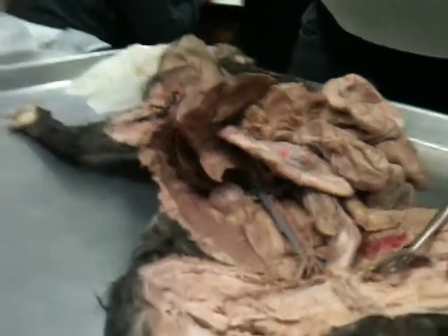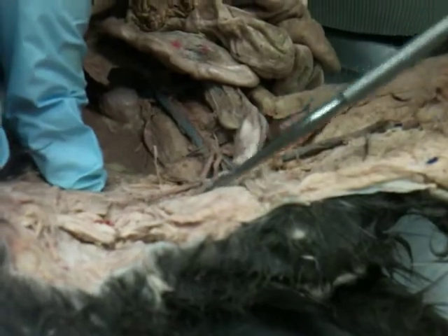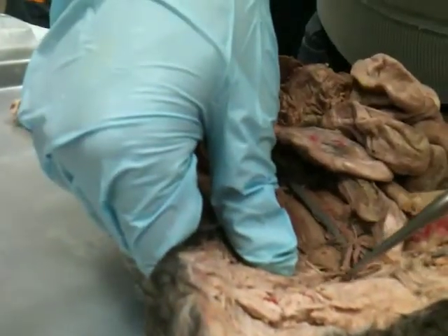Femoral. Yeah, so right here. So this is the left femoral. The right femoral didn't take the dye, so it's hard to see, but it's actually this part right here. But it looks the same as the artery, kind of, because it didn't take the dye. All right, so that's the veins. So now we can go back and do the arteries.